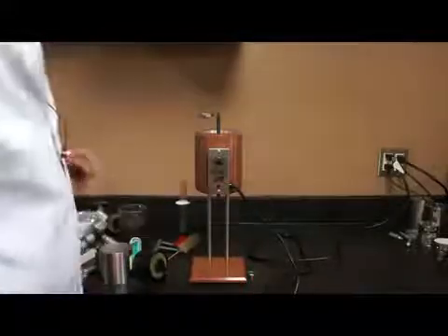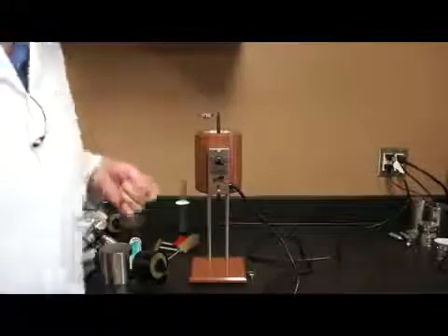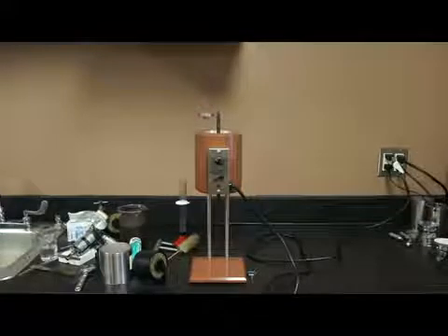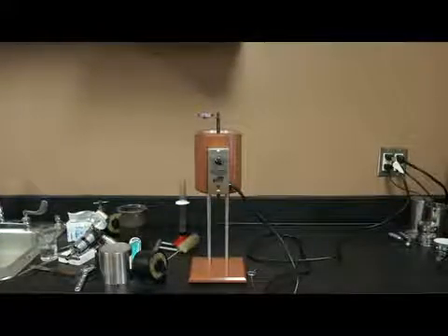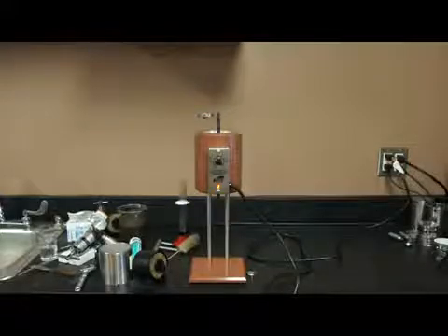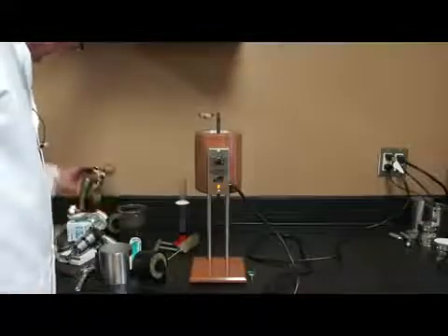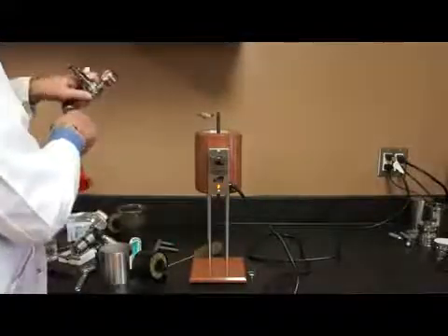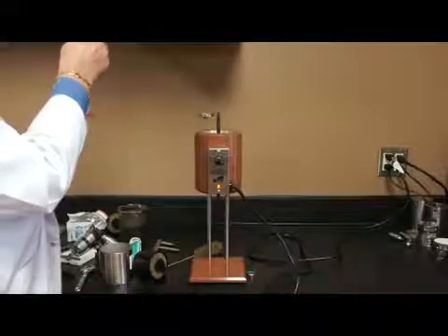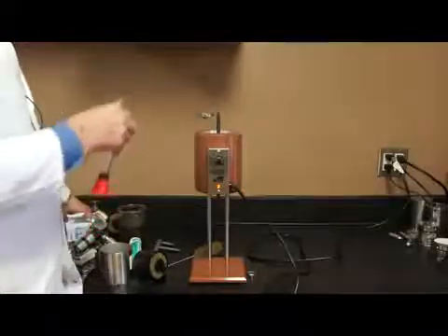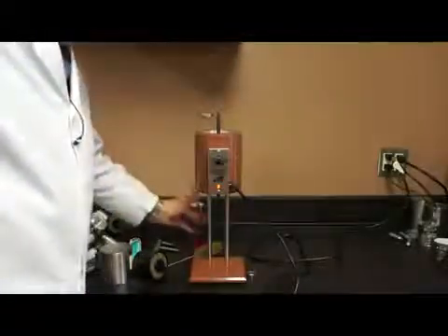So now I have my setup that is still in the heating jacket, and I still have 600 psi into the filter press. So what I want to do is drain any residual pressure that I have in the receiver tube, which probably won't be very much because I'm not collecting a lot of filtrate. But sometimes you do collect, yeah, there's a couple of drops in there that came out, but only a couple of drops. It didn't really change anything. I'm still right at 11 milliliters of filtrate collected.